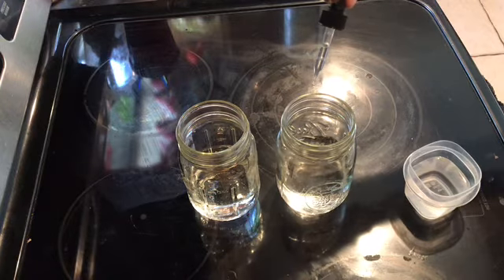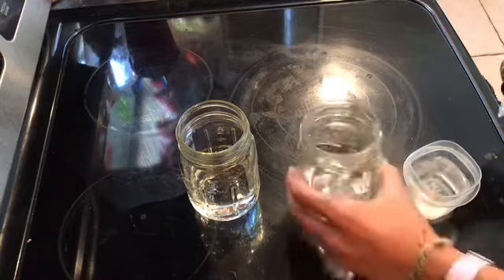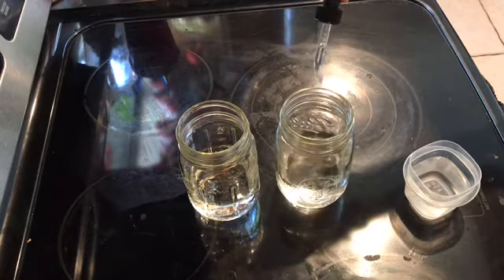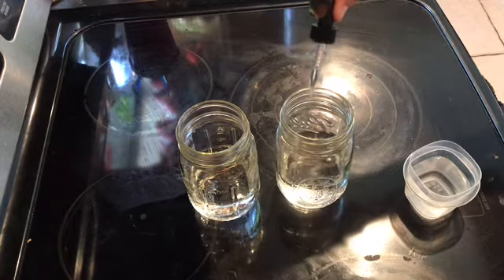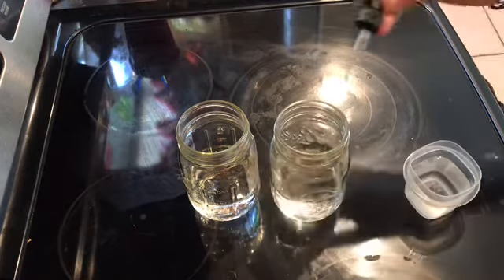The first time we measured the initial pH of just the water, we got a pH of 7, and then after adding 10 drops of HCl, there was a drastic drop in the pH, and we measured 1.70. From then, we added 10 more drops, and it was 1.50, and then after 30 drops, it was 1.30, and then after 40 drops, it was 1.10.